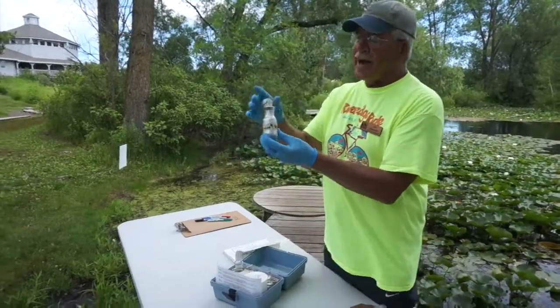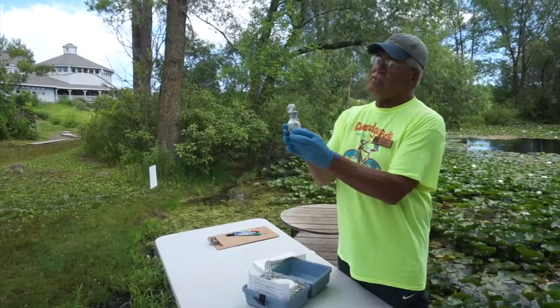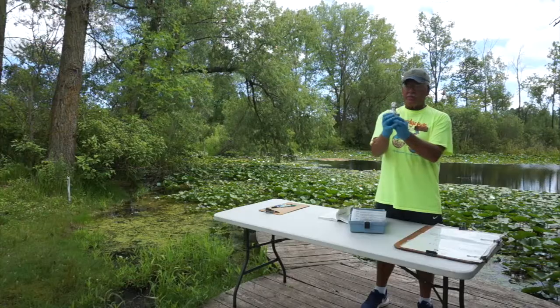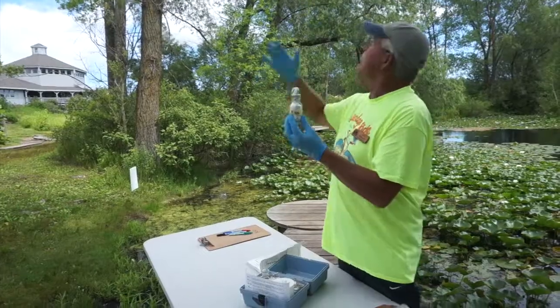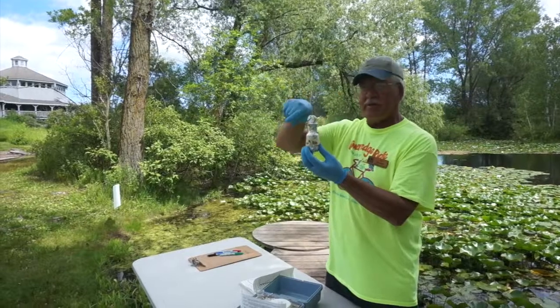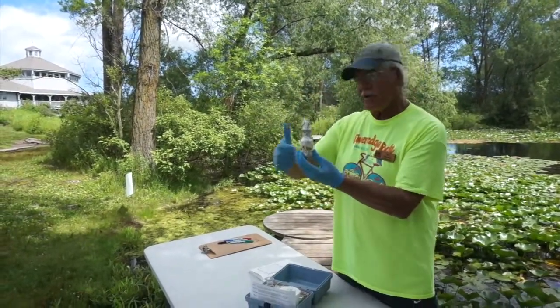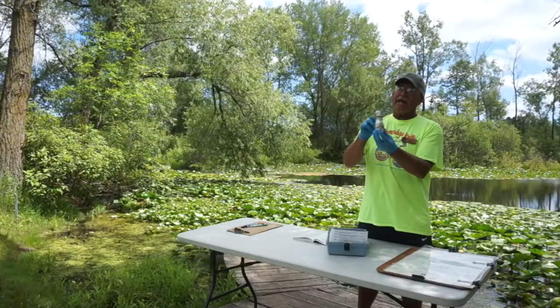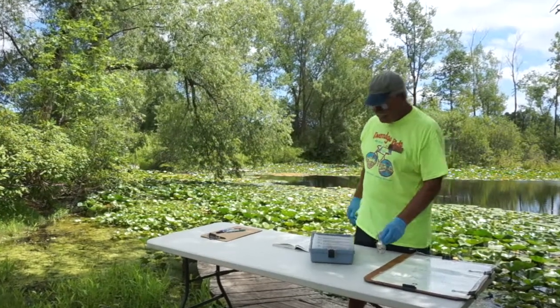You might wonder, well, why is he holding a silver bottle? Okay, the bottle doesn't have to be silver. With my students, what I used to always do is I just had a bottle and I put it in a dark cabinet. You can use this if you don't have a nice dark cabinet to put it into. It's just aluminum foil. The point is we don't want sunlight getting in here. Sunlight, if we have any types of algae or anything, which we undoubtedly will, those things are going to cause photosynthesis and they're going to raise the oxygen level. We don't want that. What we want to know is organics and let the bacteria gobble up the oxygen. So it's about as simple as that.